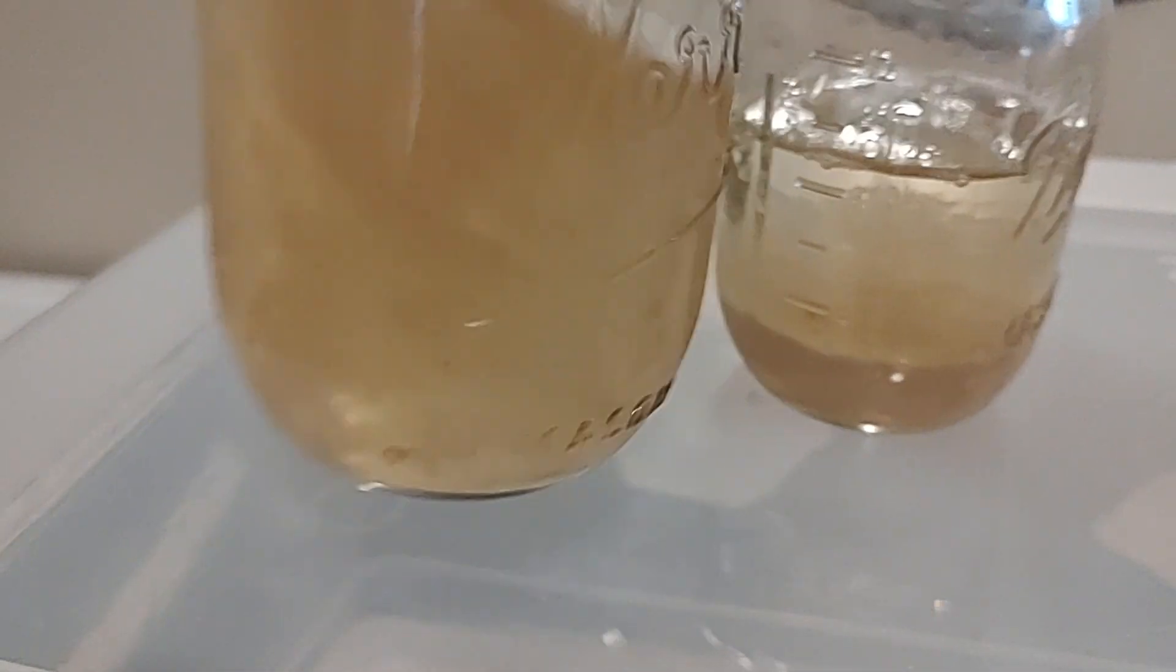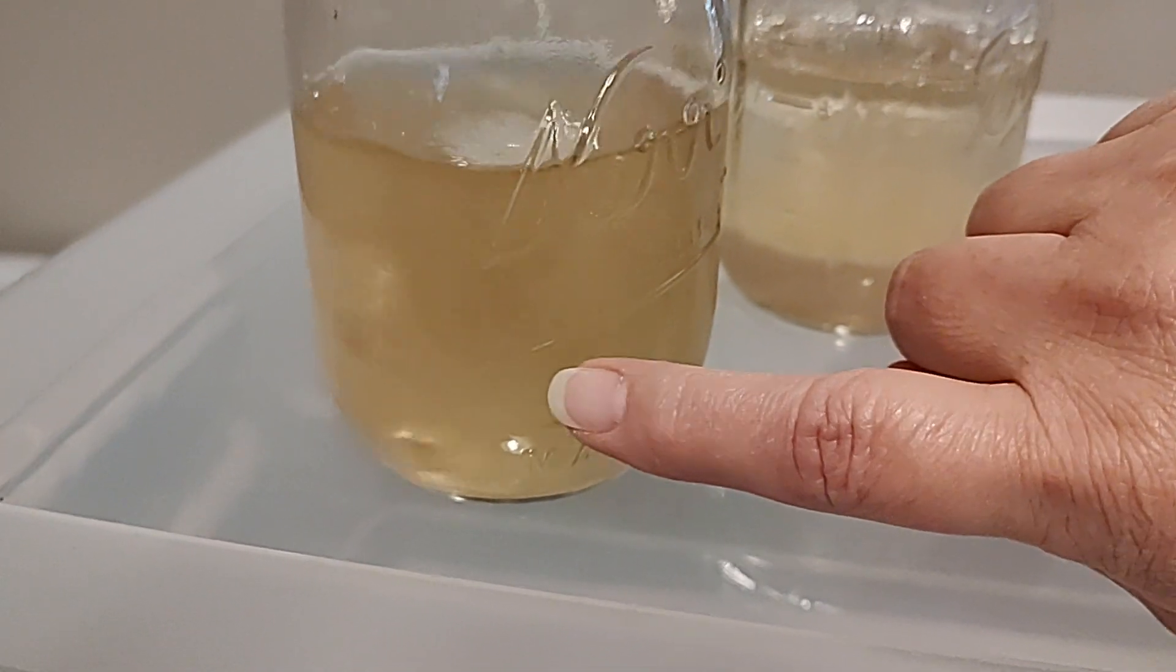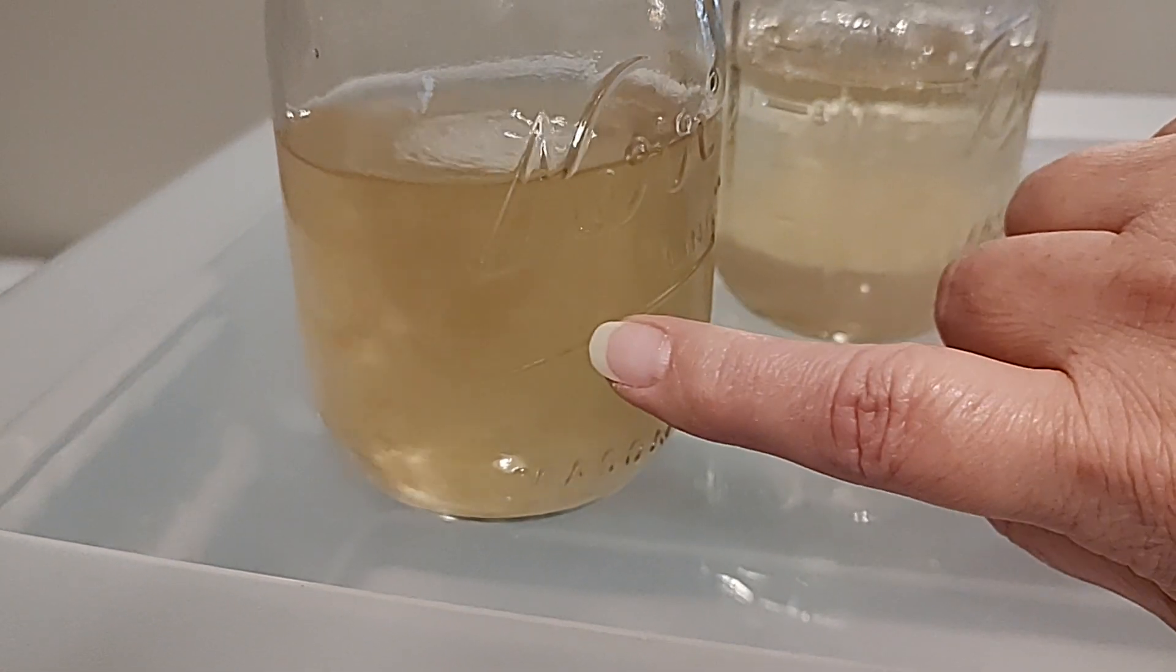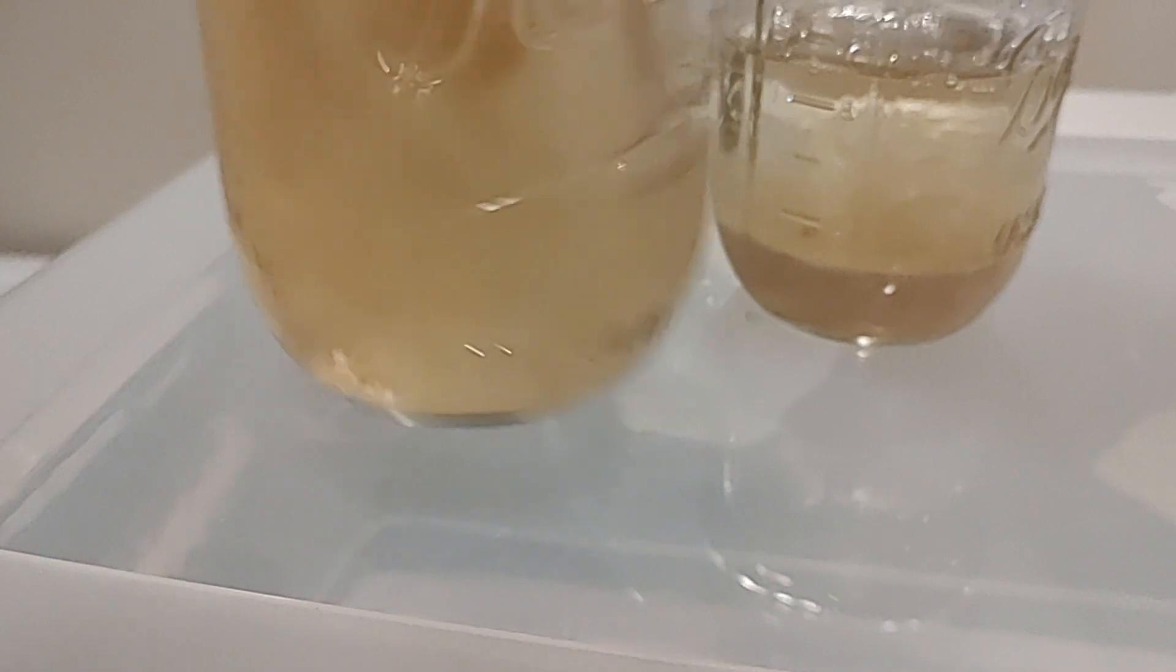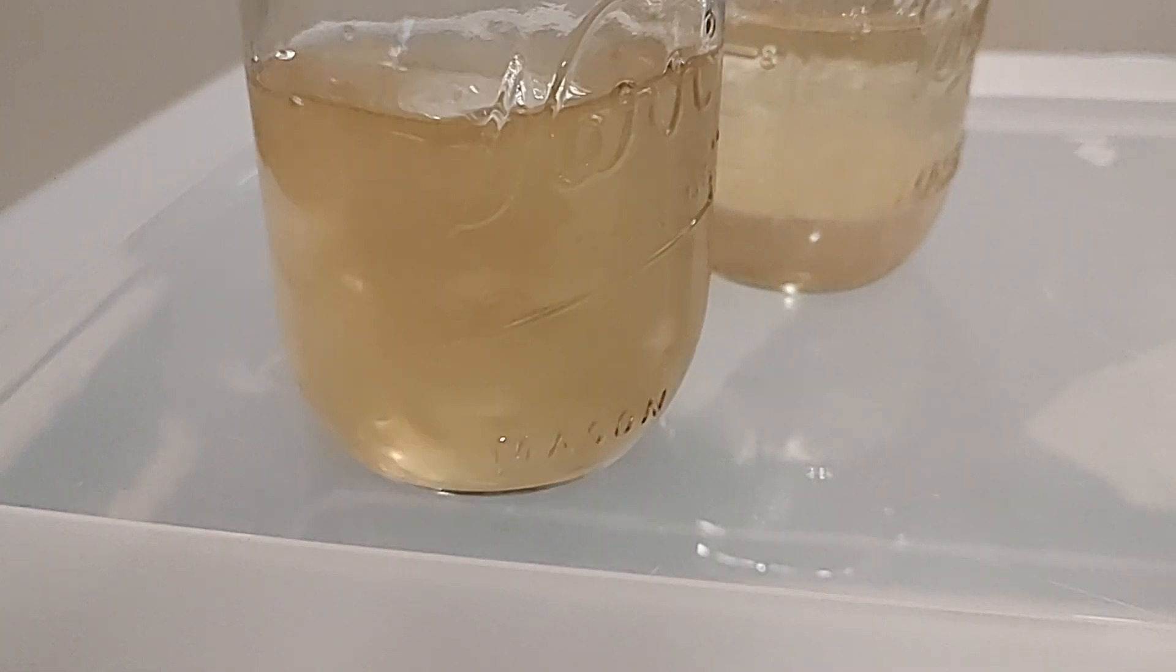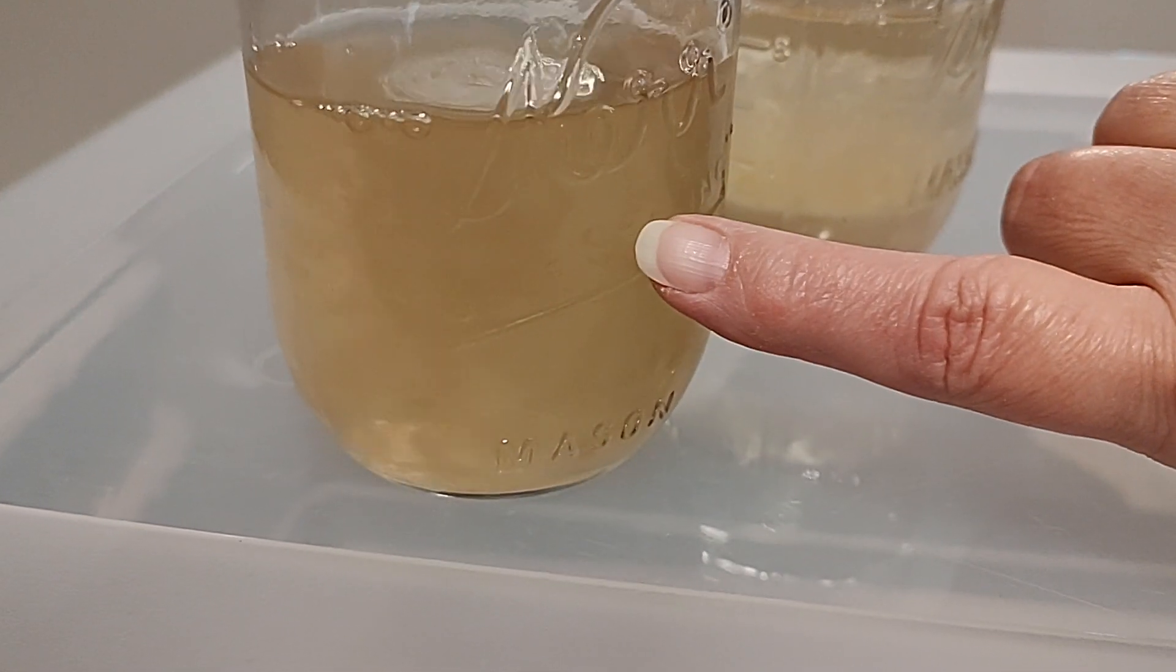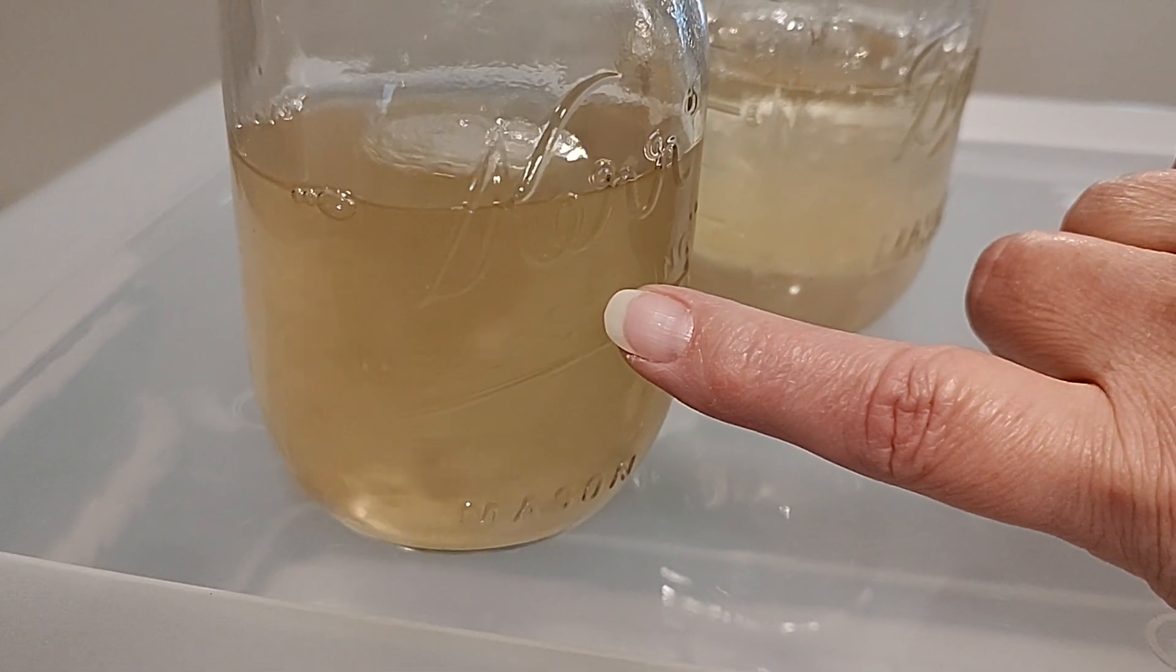When you create this liquid culture, you have this mycelium suspended in nutrients. It's an agar jar without the agar, so it's all the nutrients with the mycelium. What we do is we actually put the transfer from the agar into this liquid culture.